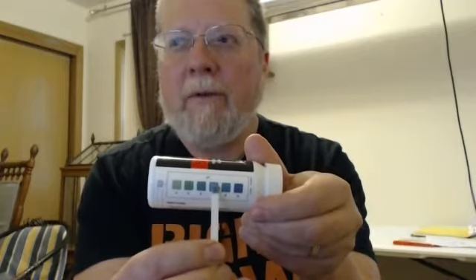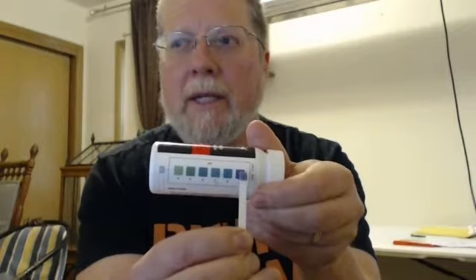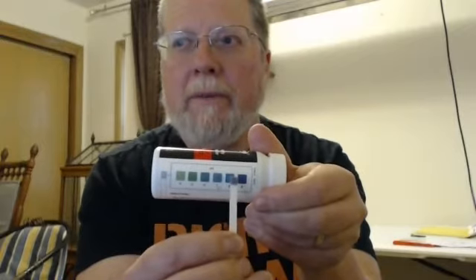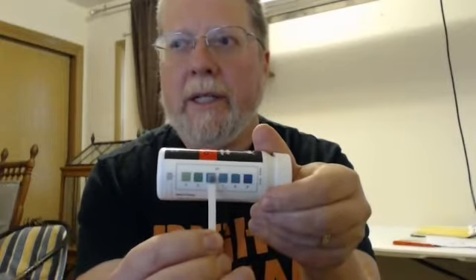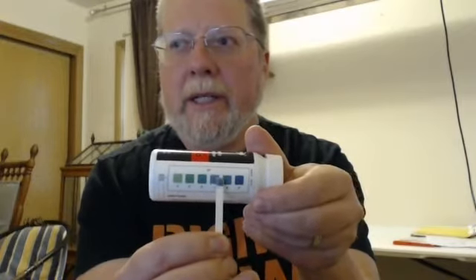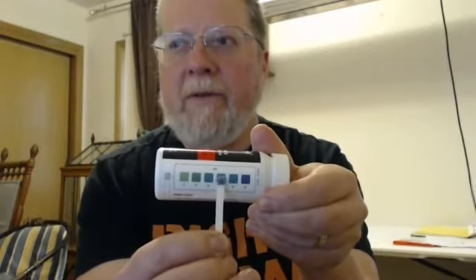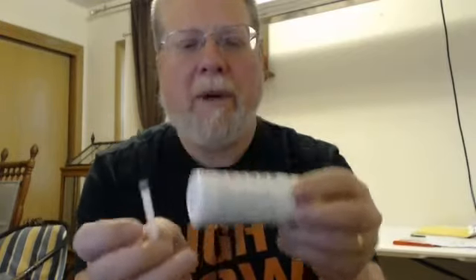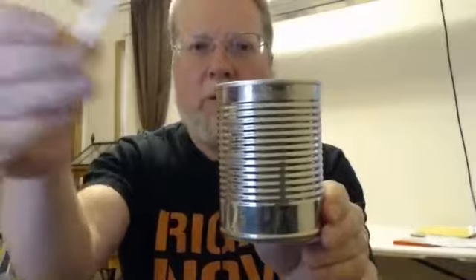We're at about that 15 point now. And I'm going to come right in. We're going to be fairly neutral here, so probably about a 7 on that one. You have a little garbage can near you. You may dispose of the tab into the garbage can.